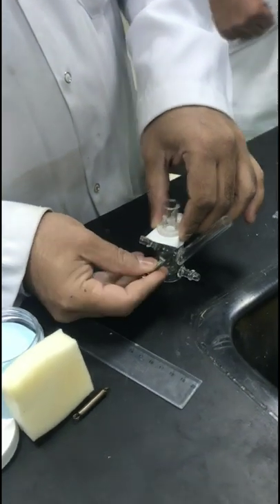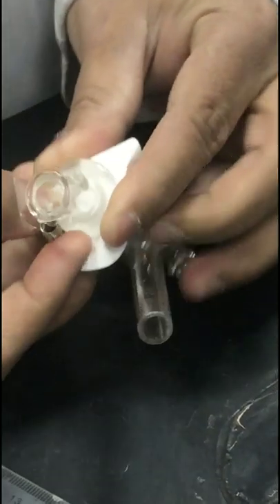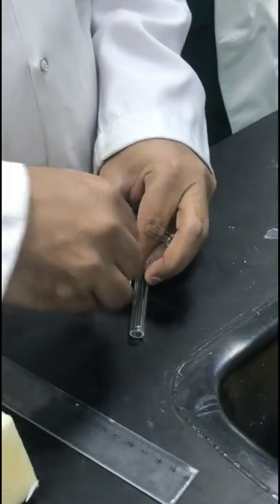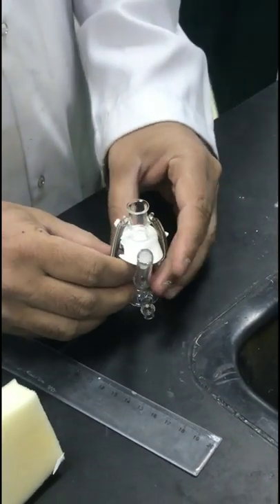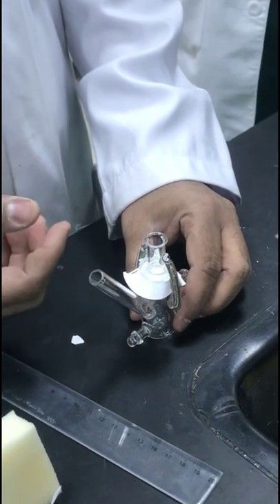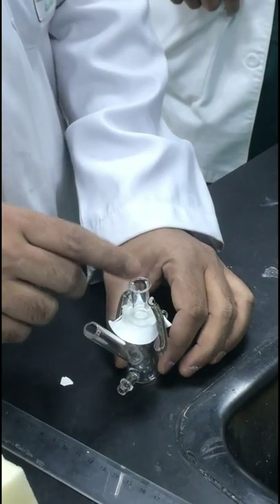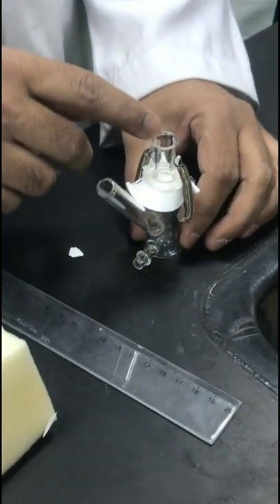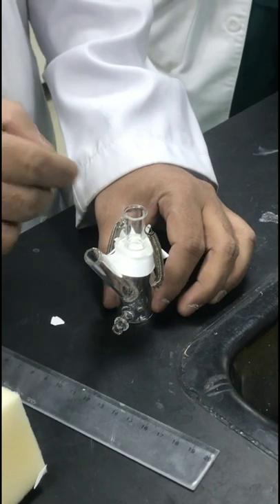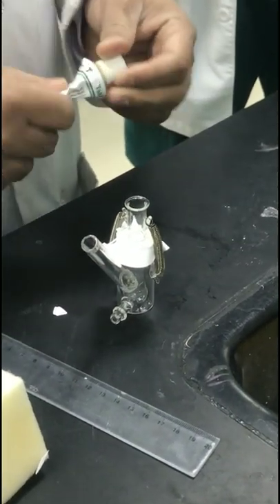After assembling, you put your drug in the donor compartment. The drug should be weighed or quantified — typically half a gram — and should cover the membrane. If it is liquid, you put in half a milliliter by pipette. If it is semi-solid like an ointment or cream, you apply it here.